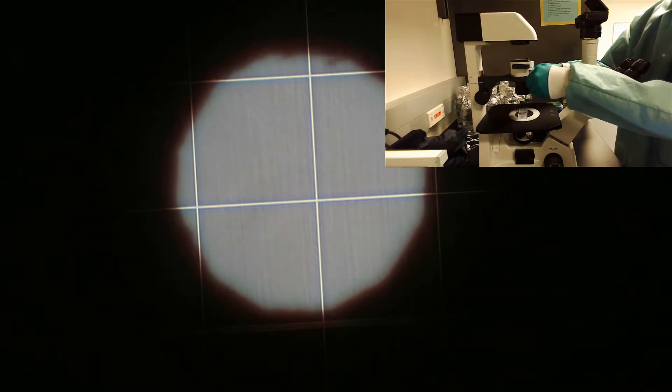And now we'll bring the hemocytometer slide into focus so you can see the lines nicely. So when we think we have the best focus, this is our plane of focus that we're interested in. Now what we're going to do is there is a shutter over the light, and you'll see it closes in on the image. Right now this shutter is way out of focus, so we don't have Kohler illumination set up. So what I can do is adjust this knob to adjust the level of the condenser lens in order to bring that ring into focus. So we're getting closer and closer. Somewhere in there the ring is in focus. I can also mess with these knobs to make sure our condenser lens is centered on the image by turning these screws a little bit, and that also gives us bright, even illumination over the whole image. Now I go ahead and open back up our shutter, and so now we have set up Kohler illumination on this microscope.